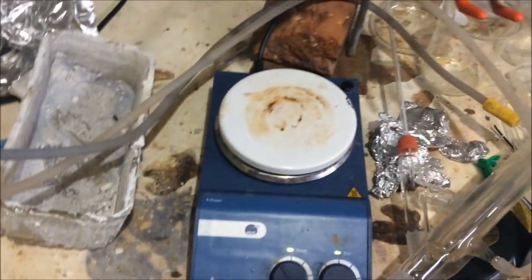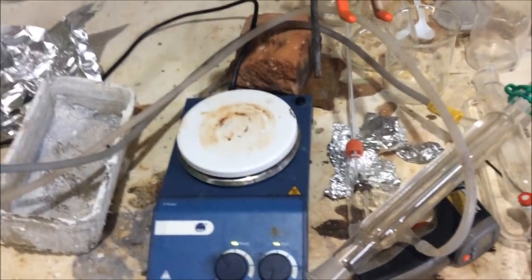And it's now not heating at all. Anyway, I'll probably make a separate video ranting about this, but this really sucks because I can't heat the stuff. I can probably use the gas stove. But it's pissing with the rain, so I can only do that outside, so we'll have to leave this all for another day.